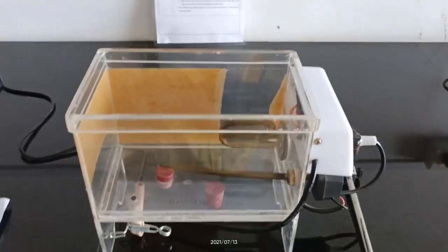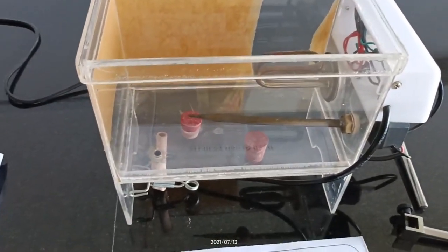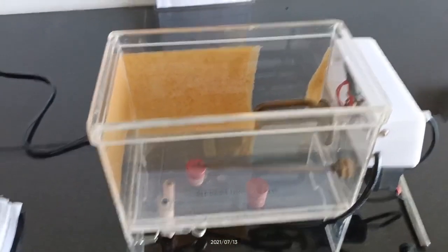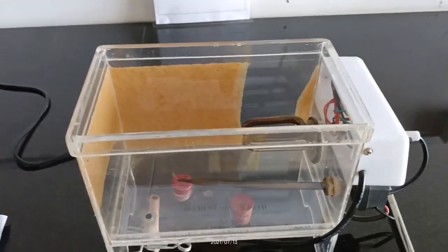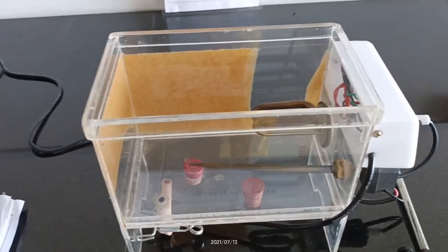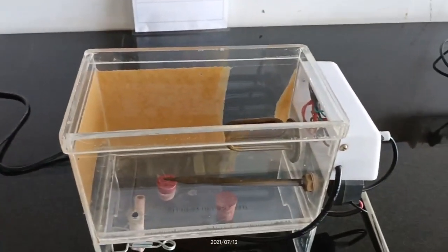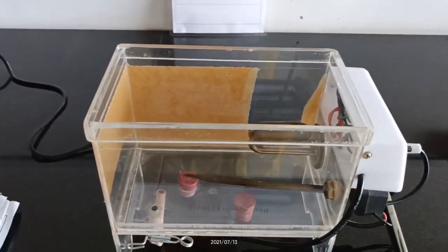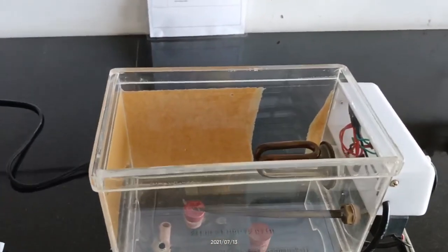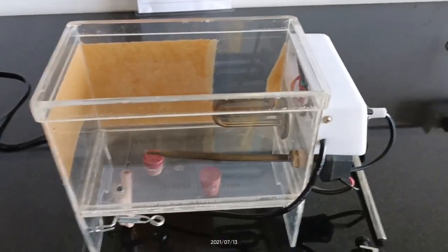When the organ tube is filled with the physiological saline solution and the tissue is placed inside, we tie a thread to the tissue. We also provide oxygen supply to the tissue. For providing oxygen supply, we use the aerator tube. The oxygen is generated by the aerator. After that, we record the responses on the kymograph paper.